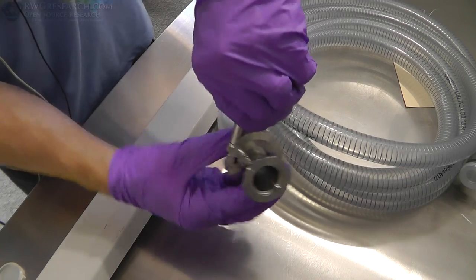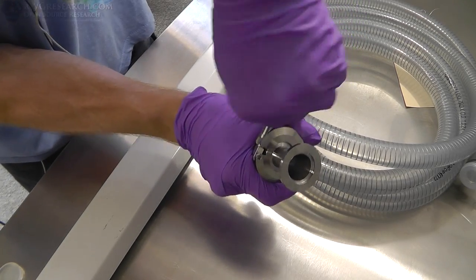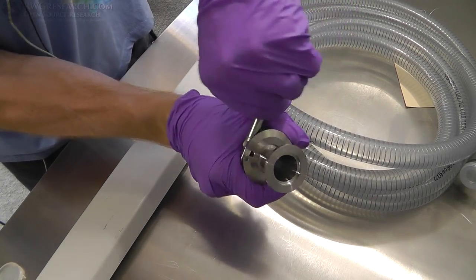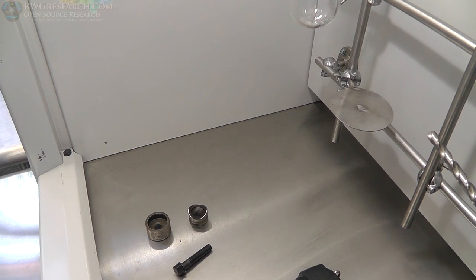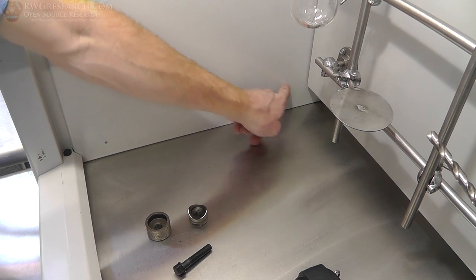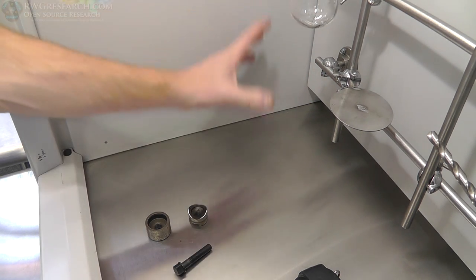And then you can crank this guy down with a proper tool. That's it. It's pretty simple. All right, guys, so I want to drill a hole for the vacuum line to come out right here. I think that'll be a good choice to have it all right here.